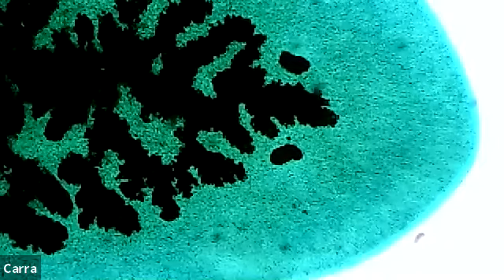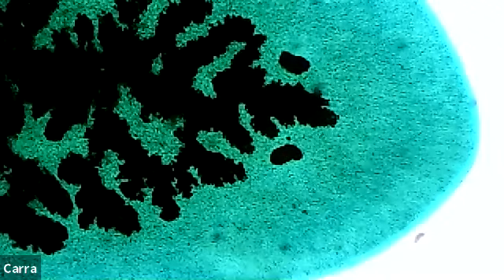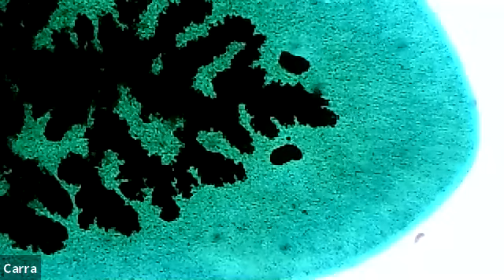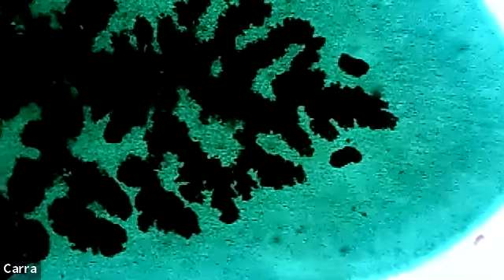So this has the eye spots, and this is the beginning of having bilateral symmetry. So I didn't mention this with the cnidarians, but they have radial symmetry, and these have bilateral symmetry, right? And so with bilateral symmetry, what happens is that you have this concept called cephalization, and that's the idea that the head portion of the body forms. And so even with these very simplistic flatworms, the head portion is differentiated from the other parts of the body here. And the other thing that is really interesting about these flatworms is they're very simple, but they have three different cell layers, and that really allows for us to have good organ development.